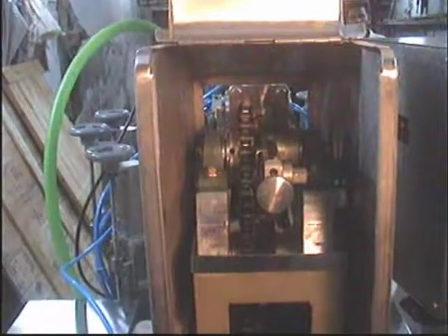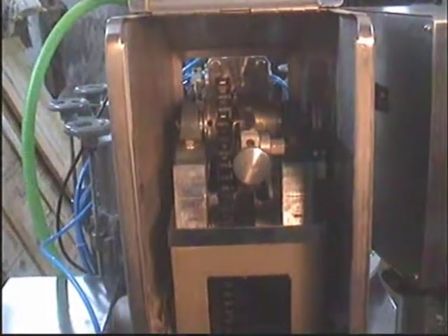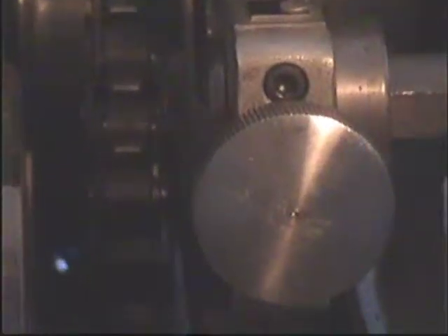You are seeing the filling block from the back side. The beauty of this machine is that when you have to remove the filling block or change the piston, you do not have to open the hopper and the filling block — from the rear side it can be done very easily. This is the piston, and here we have given a scale where you can adjust your grammage through this knob on the rear side.